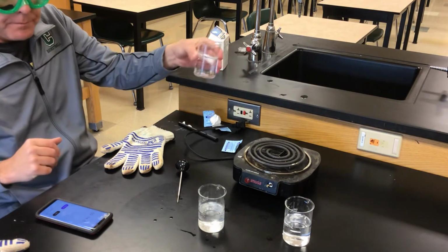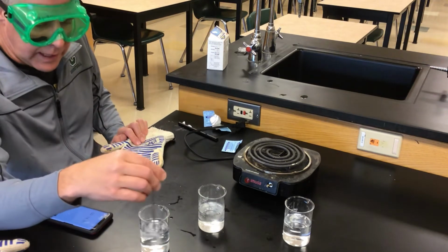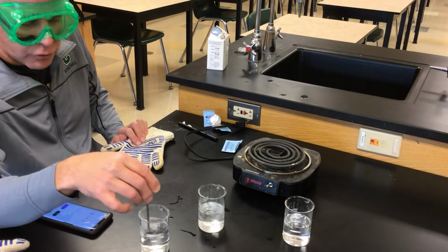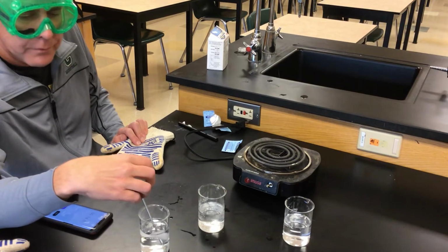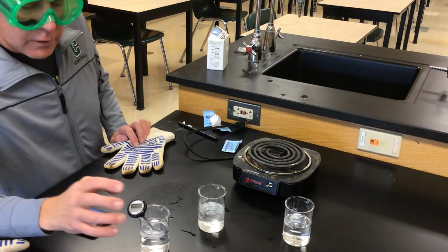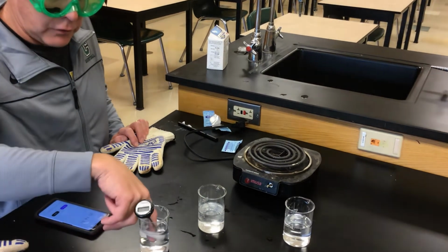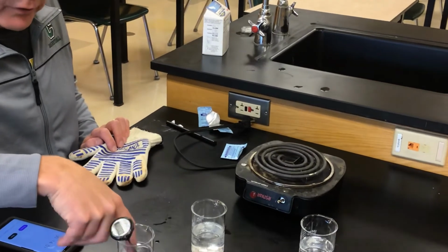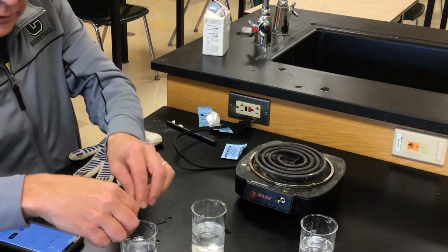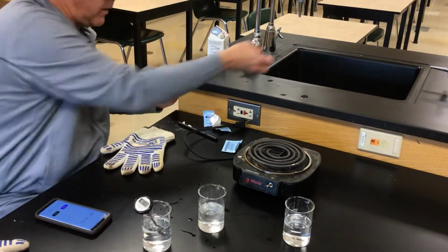Over here, I've had one sitting with an ice cube in it, cooling it down. I'm gonna stir the ice cube around for a minute to get it to cool off. Our control group was about 21, and I don't know if you can see, but I have this down to about 11 degrees. I know this is water, so it's fine to reach in and take the ice cube out, because it'll interfere with our experiment, of course, when we put an Alka-Seltzer in there.